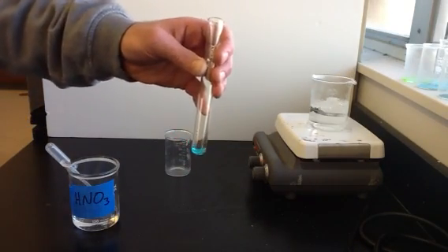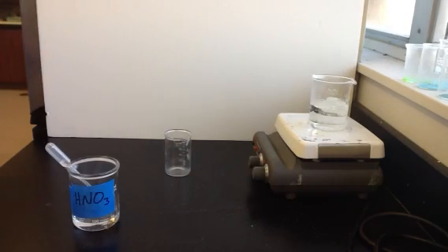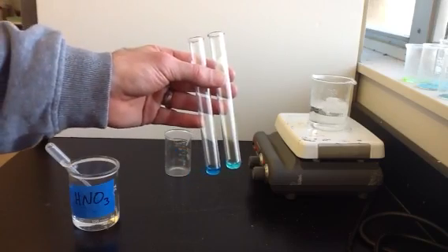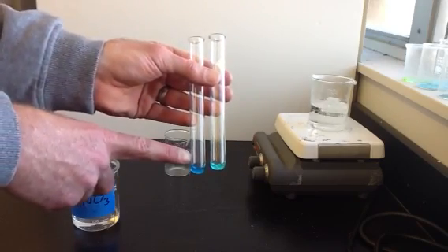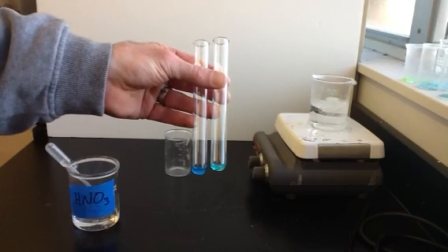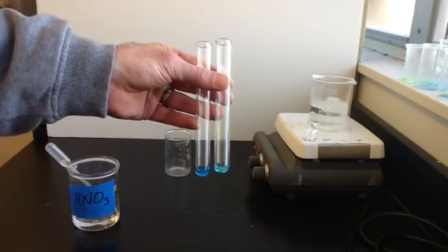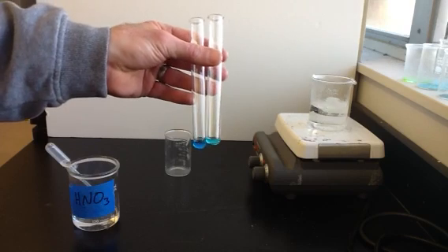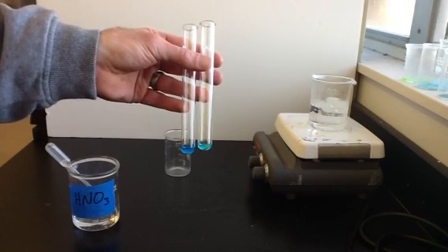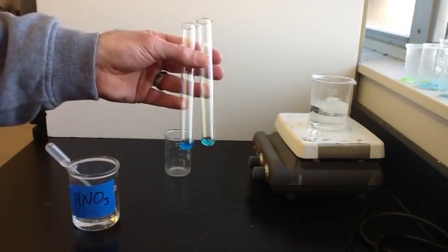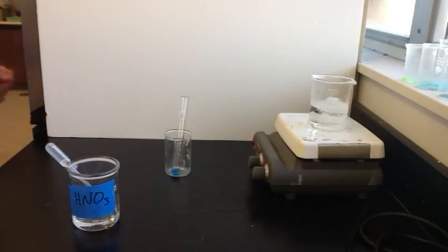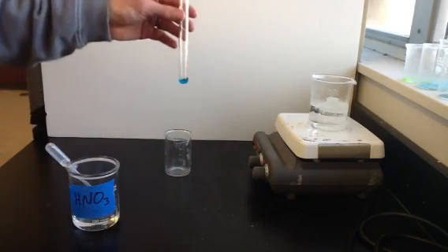This reaction we usually let sit overnight. So I have one that I started yesterday. And here's the one that I started yesterday. You can see for comparison that the one I started yesterday is now a dark blue color. The one that's only been going for 20 minutes is kind of a light blue color. And so the one that started yesterday, the copper metal is completely gone. It's completely turned into solution. And all those copper ions are causing the solution to be that bright blue color. So that reaction just takes time and I started it beforehand.